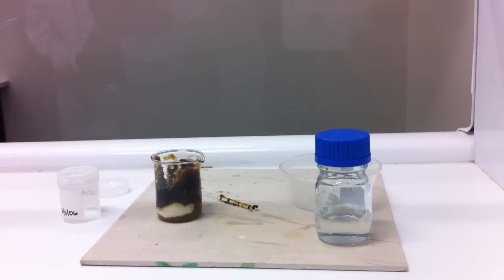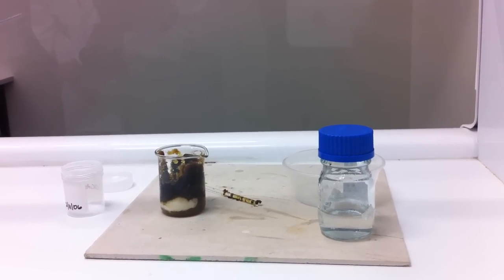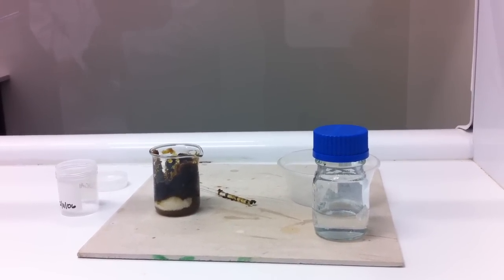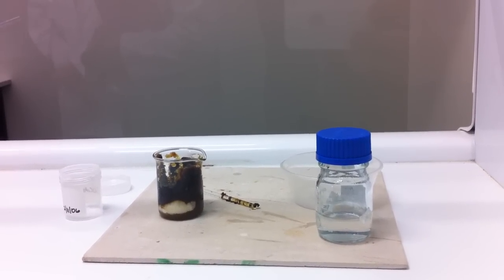And so after a while something fun will happen. As you can already see, it's changed quite dramatically. It's gone from a white sugar to a yellow color and now it's going black.